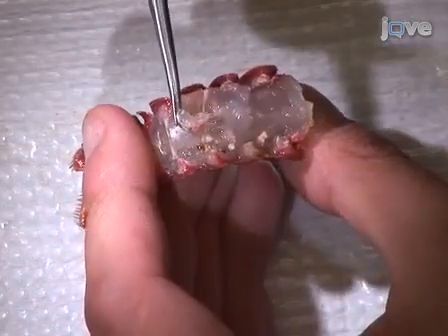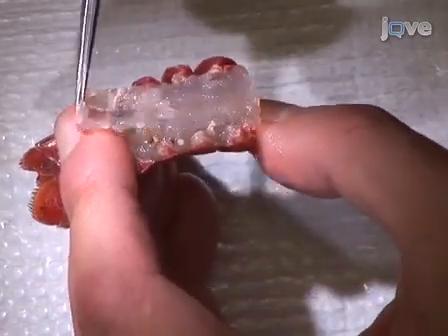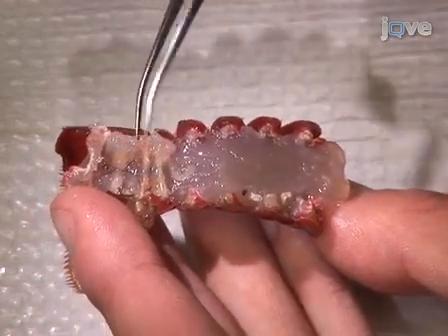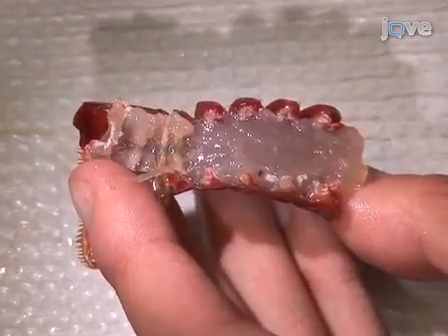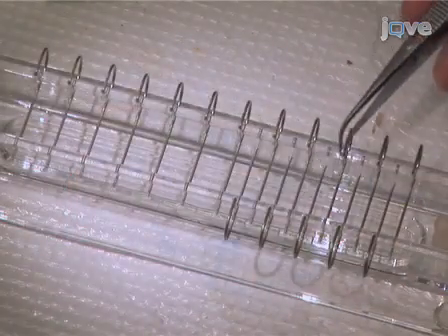Peel back the freed section of the exoskeleton to the base of the tail fan in order to expose the ventral nerve cord. Using the edge of the forceps, carefully remove the ventral nerve cord by the tip. Be careful not to stretch or crush the nerve cord. Any nodules observed on the nerve cord are crayfish ganglia. Lay the nerve cord across the metal bars in the nerve chamber.